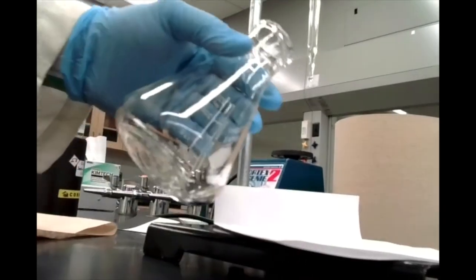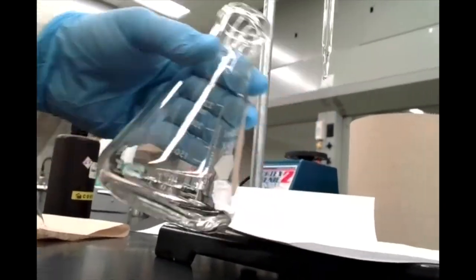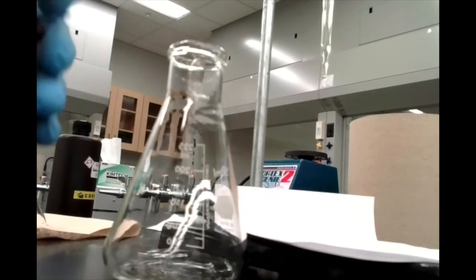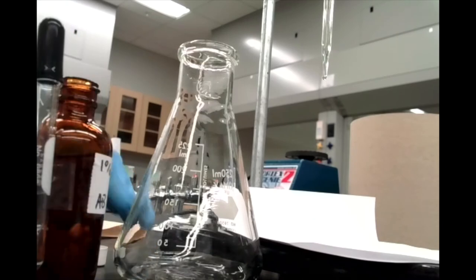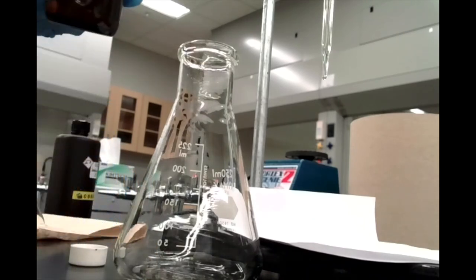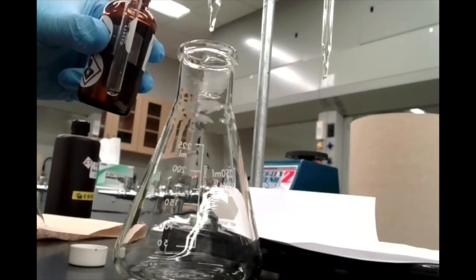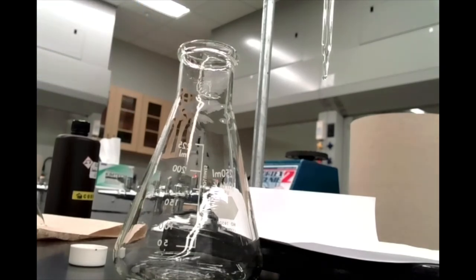I nearly made the cardinal mistake of forgetting to add my phenolphthalein indicator — that would make this last trial very rough indeed. So let's add a couple of drops in there.